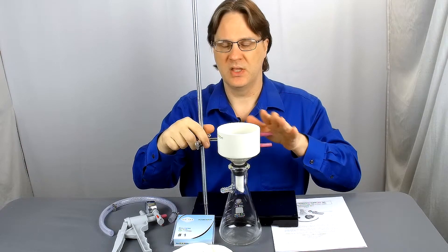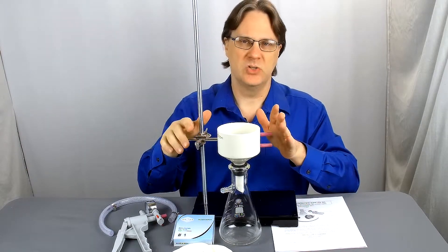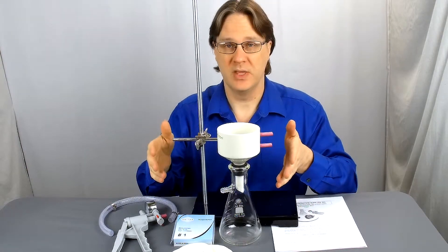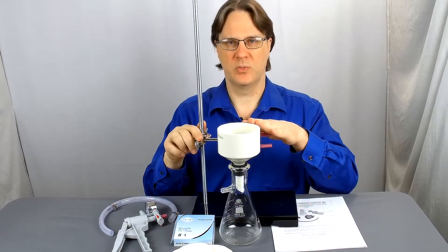But I do highly recommend putting the flask onto a good support stand so nothing gets tipped over. Last thing you want to do is lose all your hard work on the precipitate you just created during the filtering process.